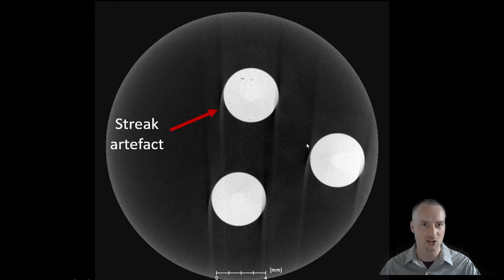When samples are secured properly, there shouldn't be any streaks. However, if a fly scan is used, where a sample is continuously rotated over 360 degrees during the scanning process and projections taken, fly scans do not have a very good angular accuracy, and this can result in the projections not perfectly aligning in the post-processing. As such, streaks similar to this may be seen.